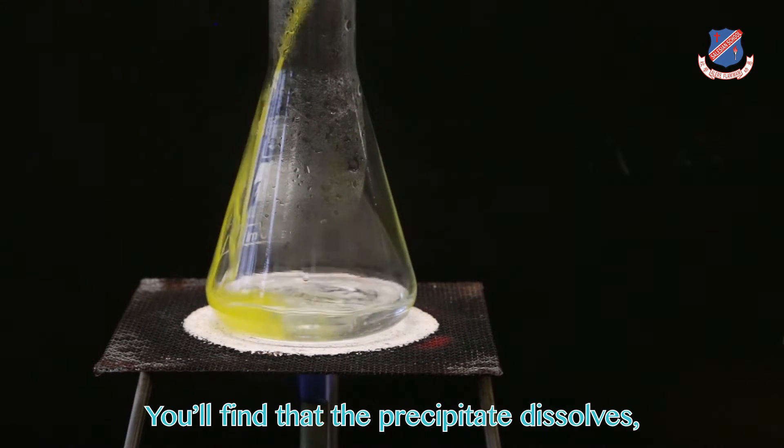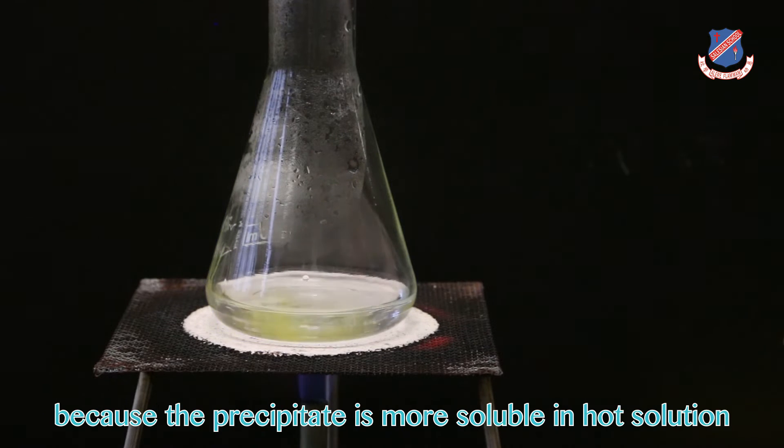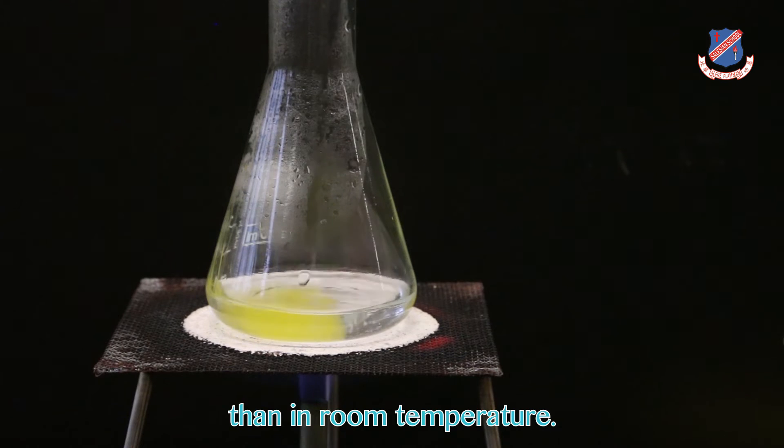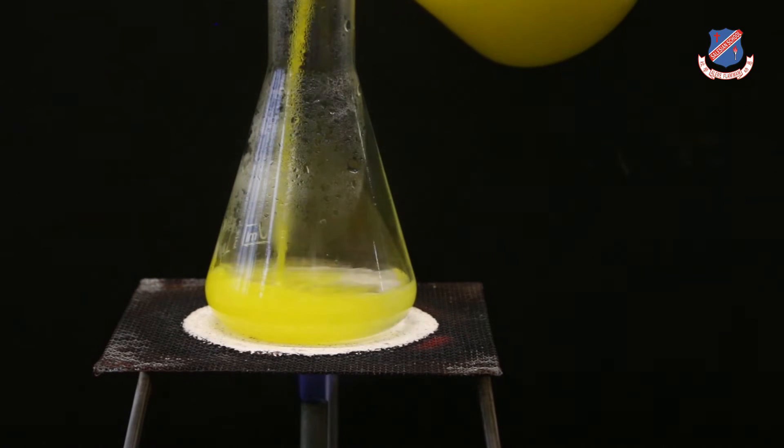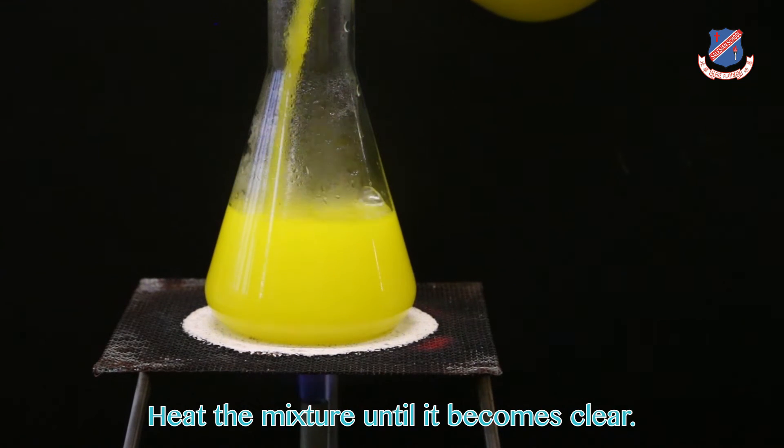You'll find that the precipitate dissolves because the precipitate is more soluble in hot solution than at room temperature. Heat the mixture until it becomes clear.